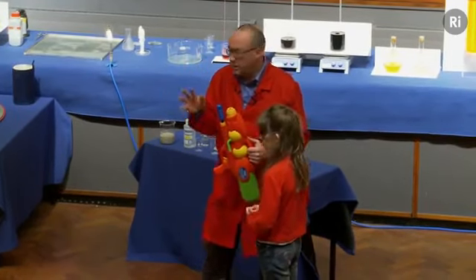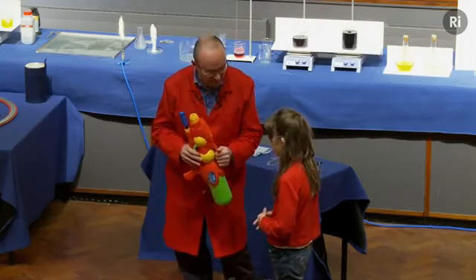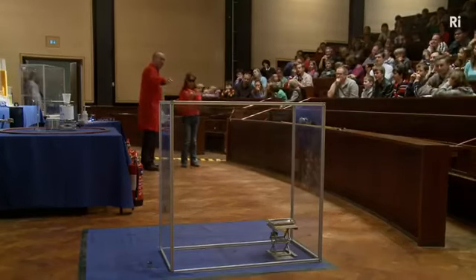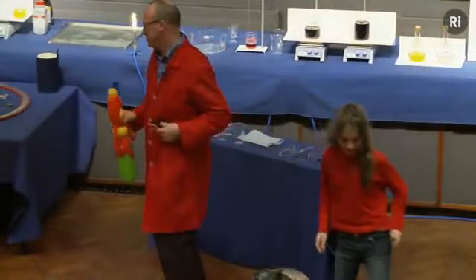So my suggestion and my recommendation is that you don't look directly at the dish, but instead you look to one side. Now, you do need to look at the dish because you need to see if you can hit it with the water, so that's why we've given you these special goggles. All right, so off you go, see if you can get a bit of water into that dish. Oh, well done. Thank you very much. Okay, thank you.